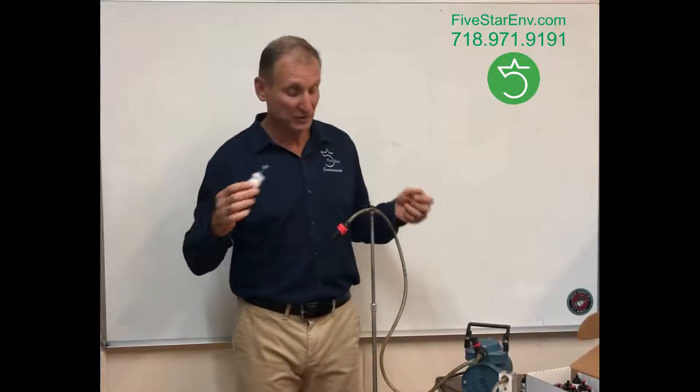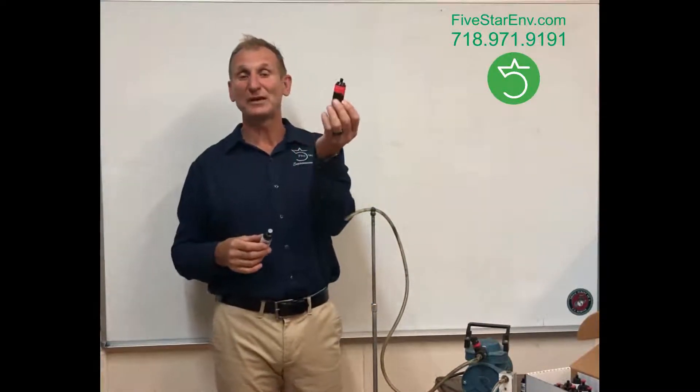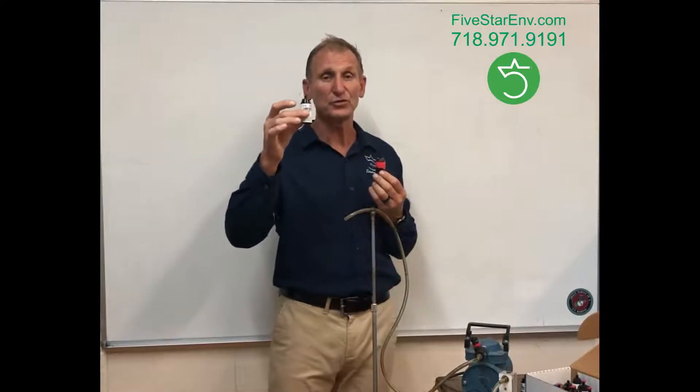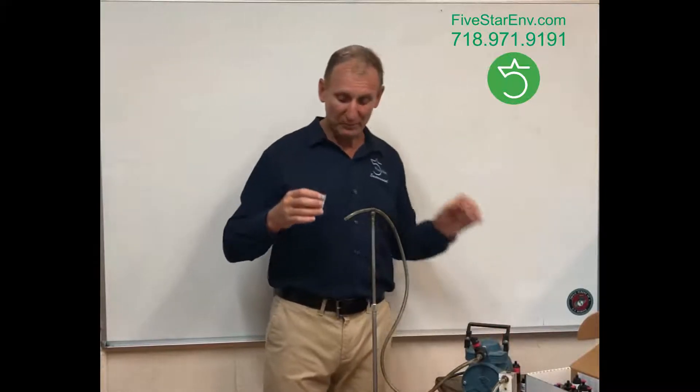But this TEM cassette method allows us to name the type of asbestos which was detected. It's no longer just a fiber count method that tells you we see fiber and how much — this tells you we can actually identify the asbestos fiber and tell you how much. So this method is superior to PCM. You might ask why we bother with PCM since TEM actually names and quantifies asbestos. Well, the price: TEM is almost ten times more expensive. That's why we prefer to use PCM first, and if the results are confusing or inconclusive, we go to TEM. But most of the time we get a very good answer from PCM.